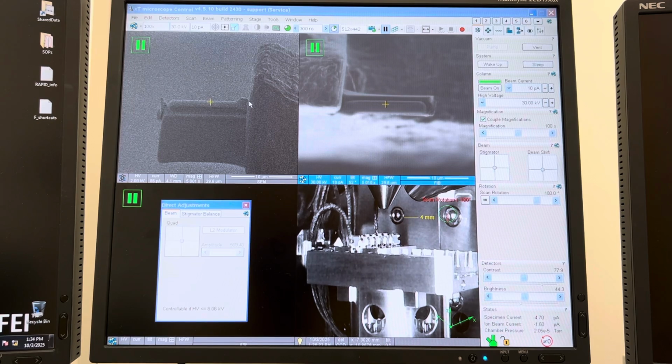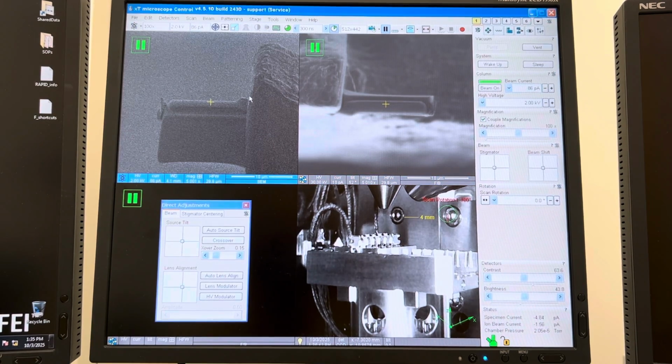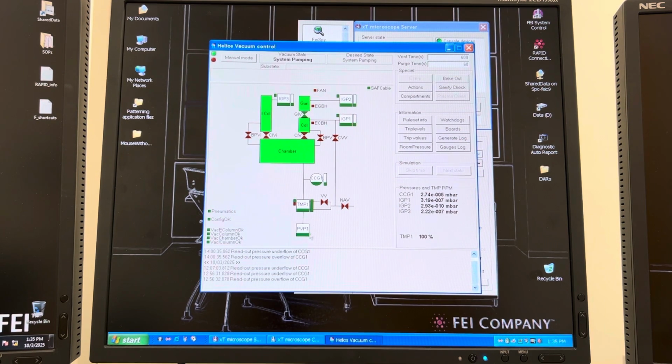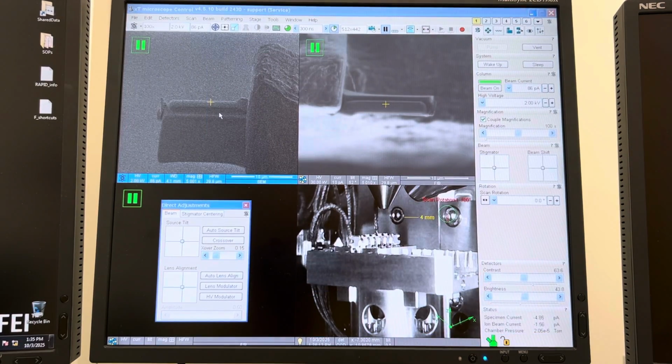and sometimes you can control this. I don't know why the chamber lost vacuum. Again, I've seen that happen where the TMP, or I think it's the roughing pump actually, not the TMP, because the TMP has to be backed. Again, let me pull up the diagram here. But the TMP is backed by the pre-vacuum pump, and if the pre-vacuum pump doesn't stay on, the TMP will shut off, okay? So I think the issue is with the pre-vacuum pump and not the TMP, but for some reason that will randomly turn off.